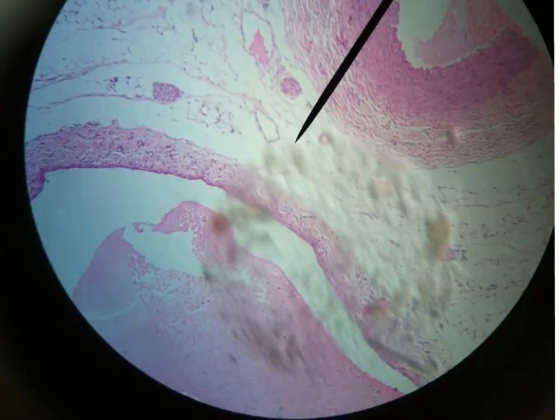In the other part of the slide, you will notice the vein, characterized by thin wall and wide lumen. The intima is more or less straight, no elastic lamina inside it, and the media is very, very thin, just 1 or 2 layers of smooth muscles, and then we have the externa formed of the areolar connective tissue.